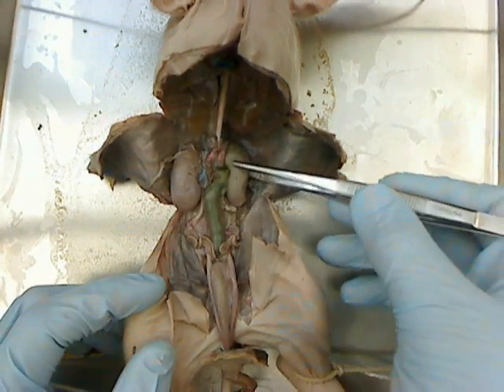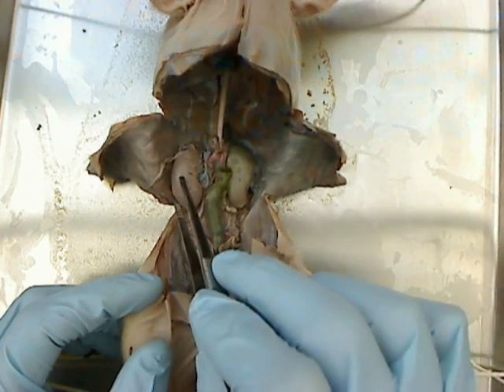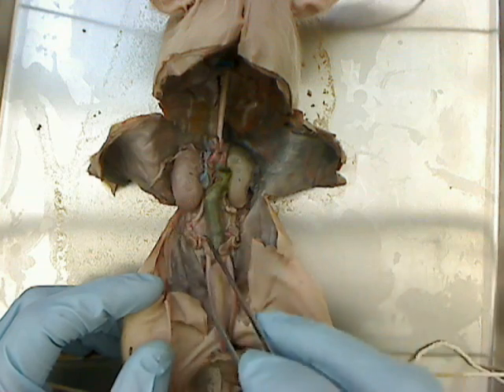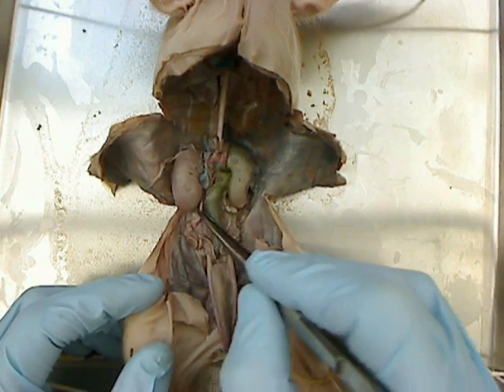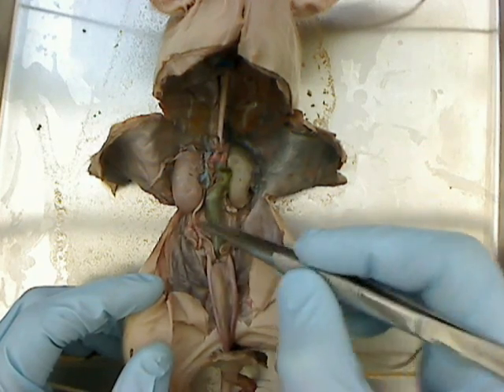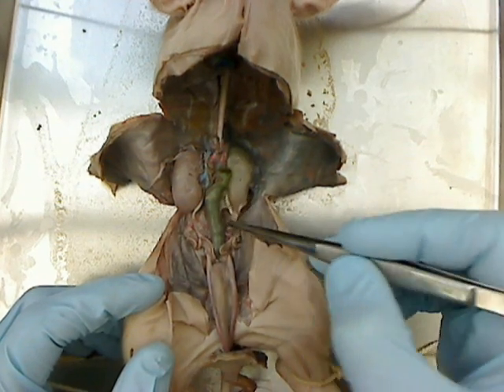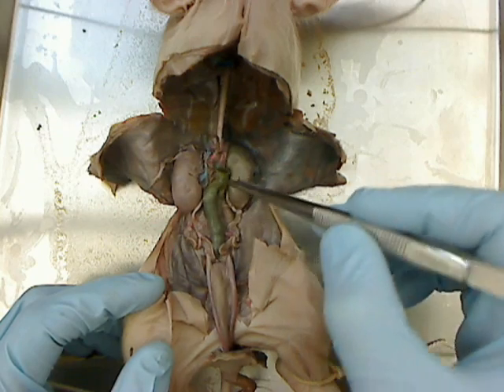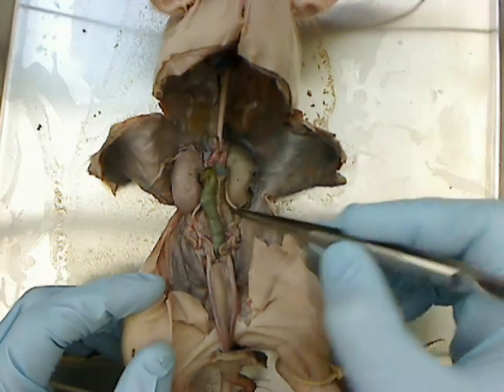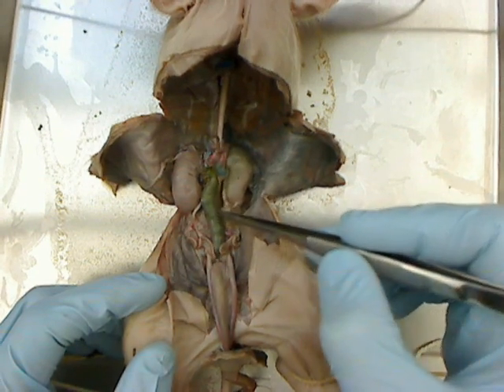The kidneys are here. This is the left kidney, and this is the right kidney. This is the right ureter — this little tube coming down. And this is the left ureter. The green thing in the center, by the way, is part of the large intestine. I've dissected out all the other digestive organs.